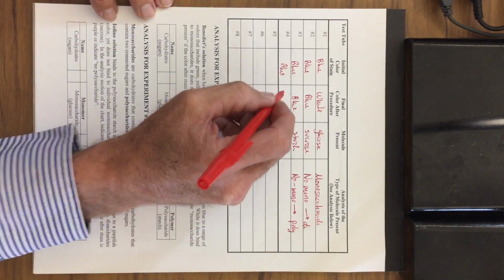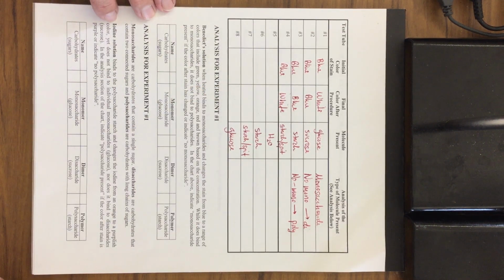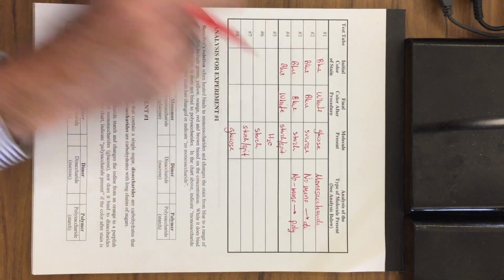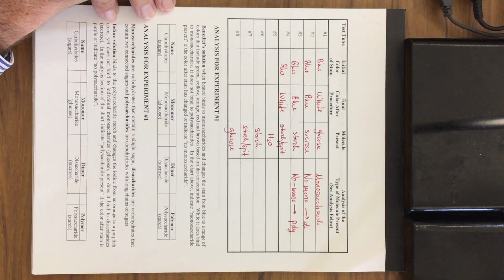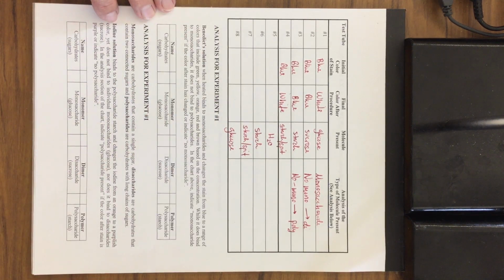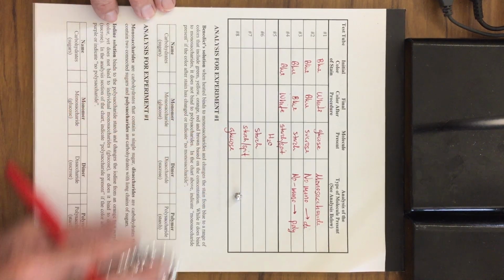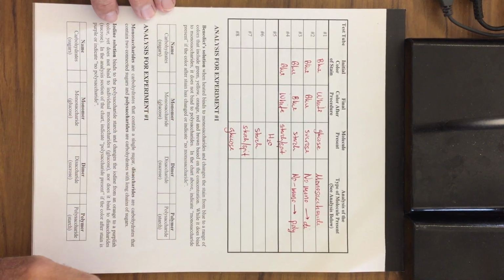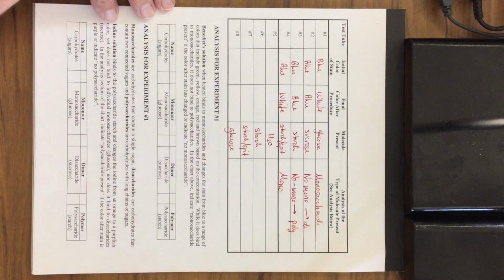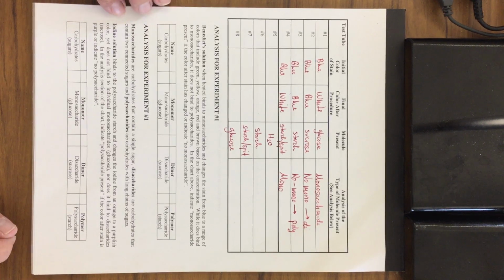And the last one changed to a white color. Again, the reason why is we had starch. So number 4 should look very closely to number 3, but again, we added the spit. And the spit acts as the scissors to chop up the polysaccharide into monosaccharides. So of course, we're going to have monosaccharides present. So we're going to say yes, we have monosaccharides present, and you can go ahead and abbreviate that one. Those are the results for the first experiment.